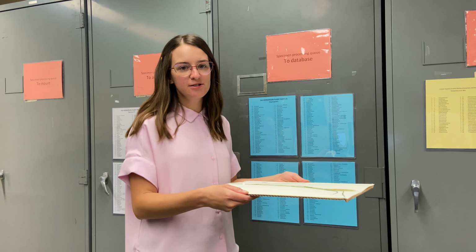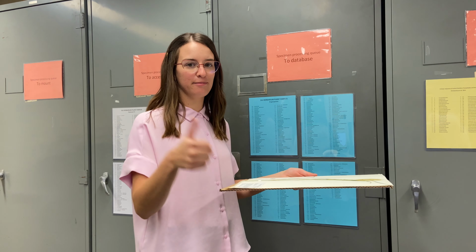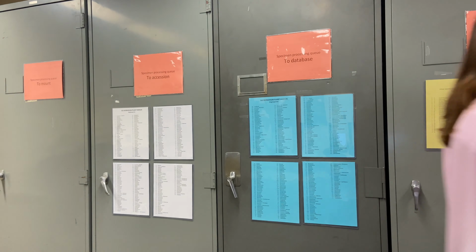When you have your specimens ready, let's head on over to the databasing computer. It's important to note that each specimen is unique. So while we will provide the general formula on how to database, you will encounter some nuances while databasing. For example, some specimens may be very old and use cursive writing that's difficult to read. Some specimens may occur from localities that use different languages. So while you're databasing, you may have to do some investigation, but that's kind of what makes it fun.